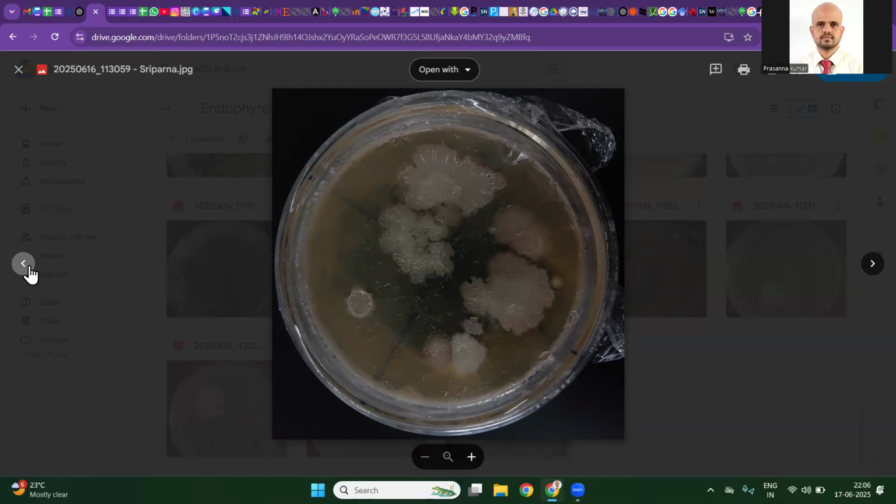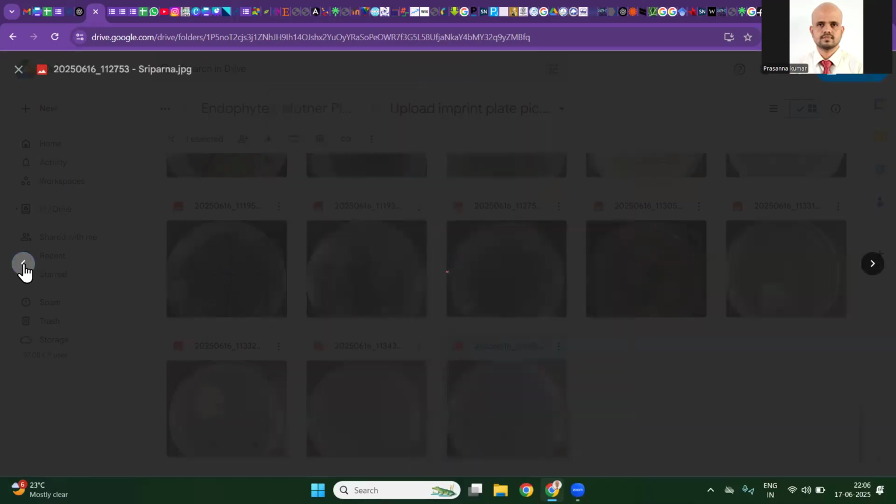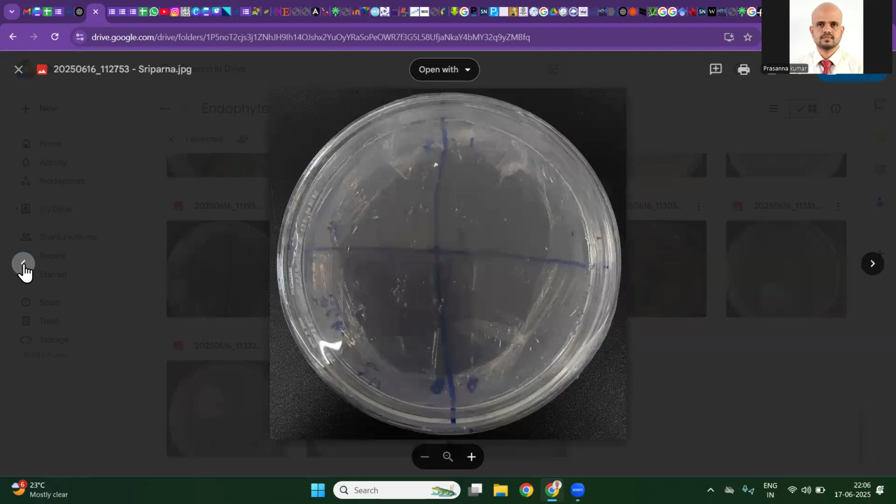You can share your improvements. In this plate, in all four quadrants, you will see we have Bacillus, so it is a contaminated one. This is a relatively clean control. These are imprint plates you are seeing. Next time when you take a picture, I can see the phone shadow here, and I can see the wrapper not removed. For every picture you should remove the wrapper and take the picture.